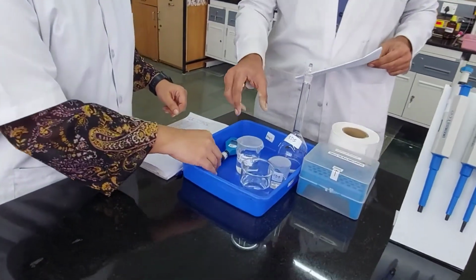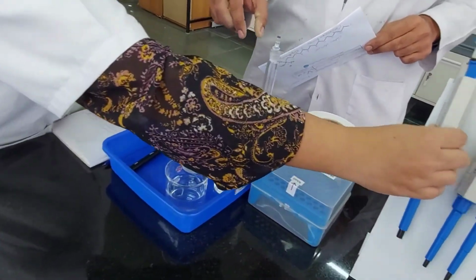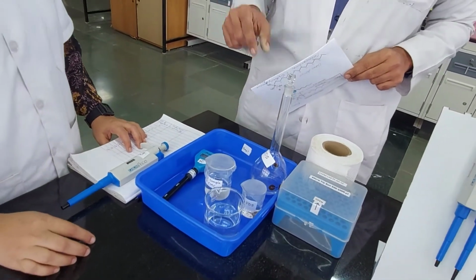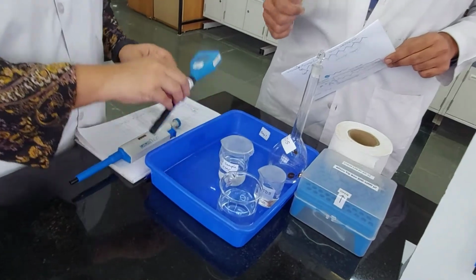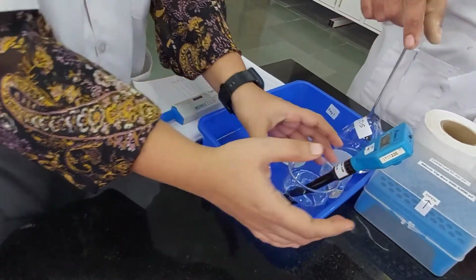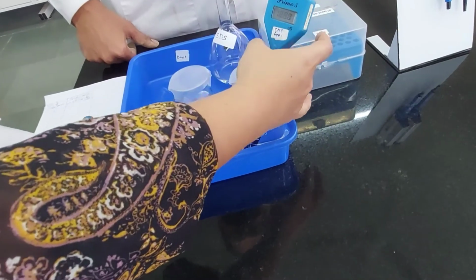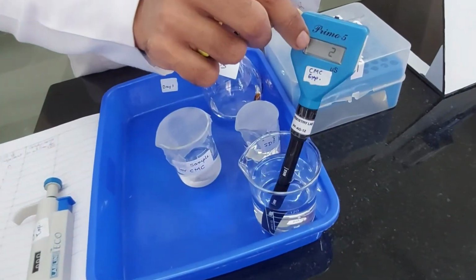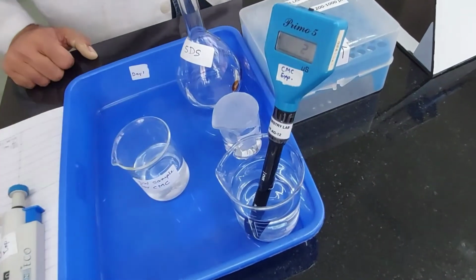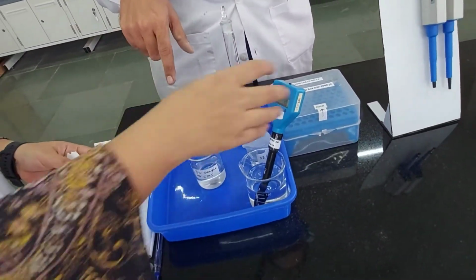Okay, let's begin. We are going to start off with our conductometer. We will be putting it in water, and rinse. If you see the display, there is almost no conductivity here. Can you zoom in, Rupesh? It says only 2 units. That's our experimental beaker.